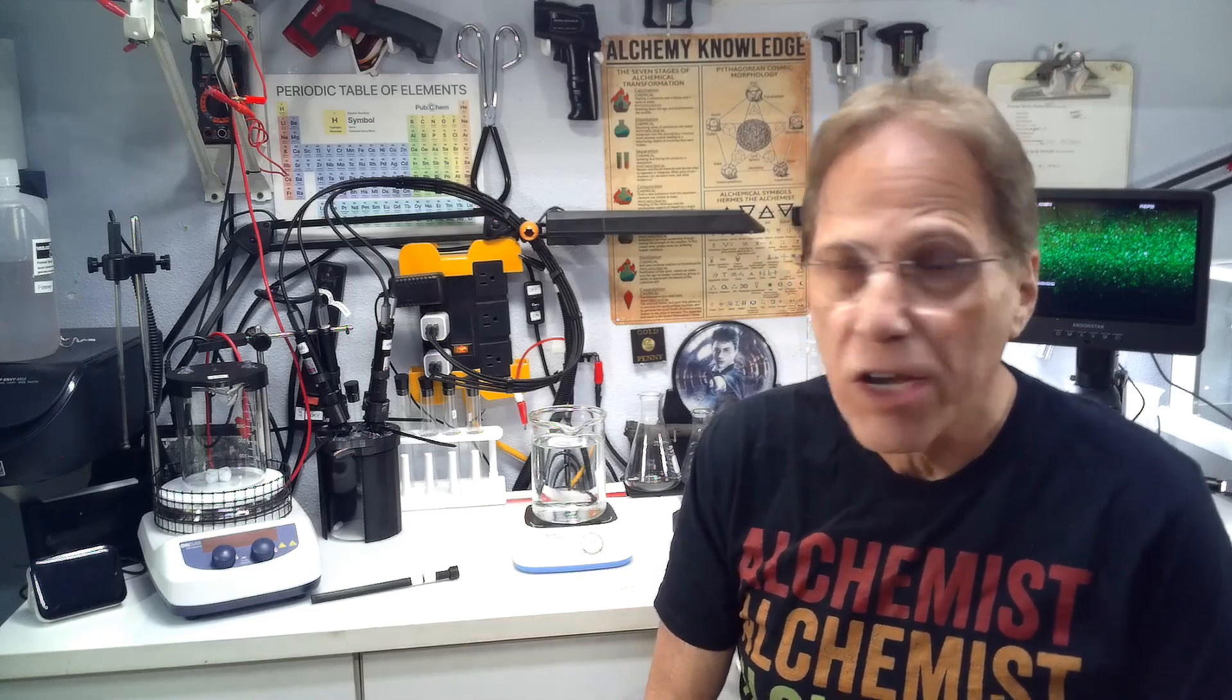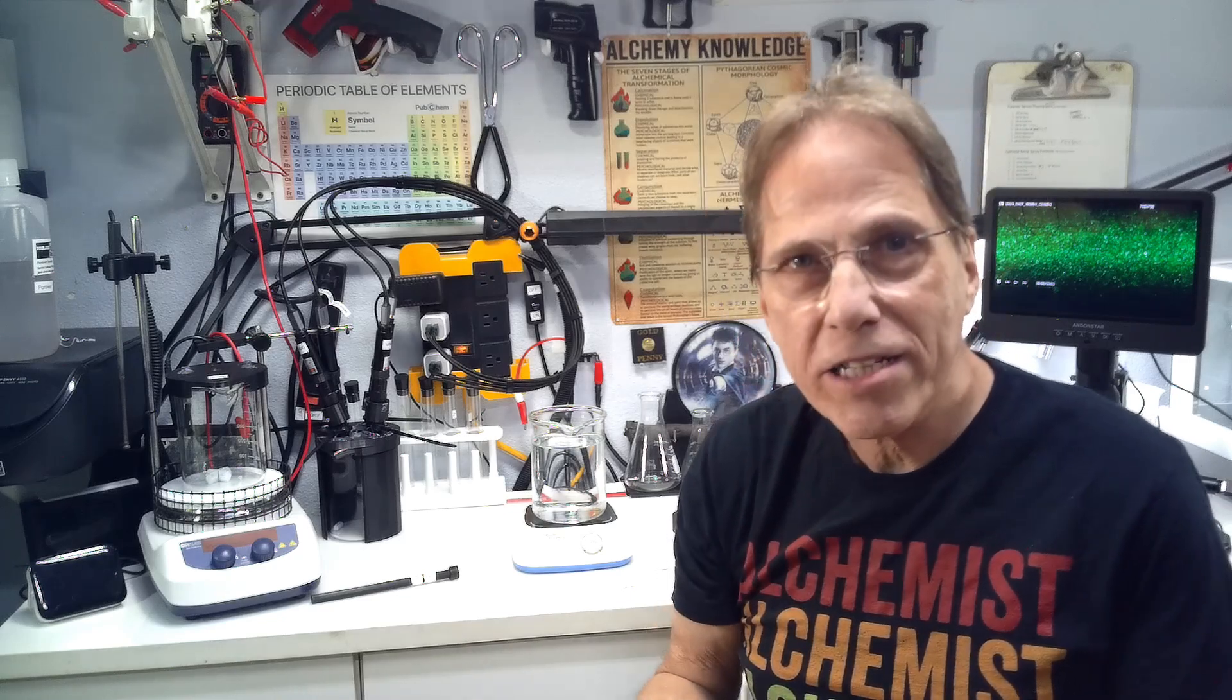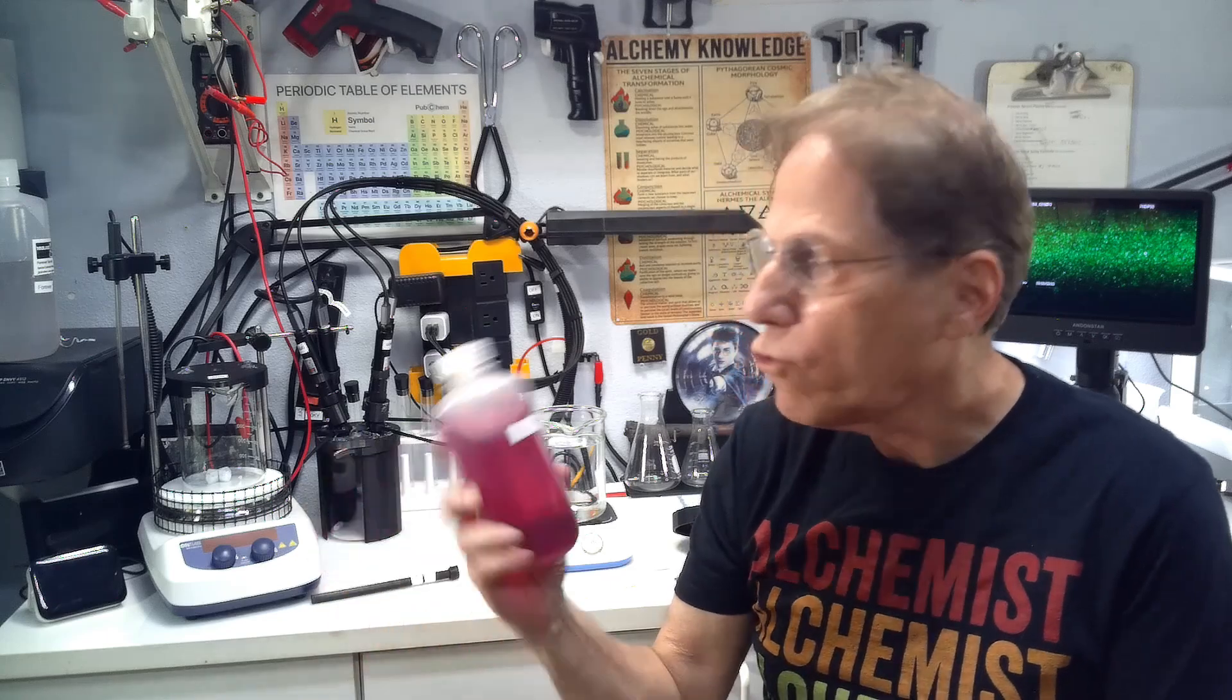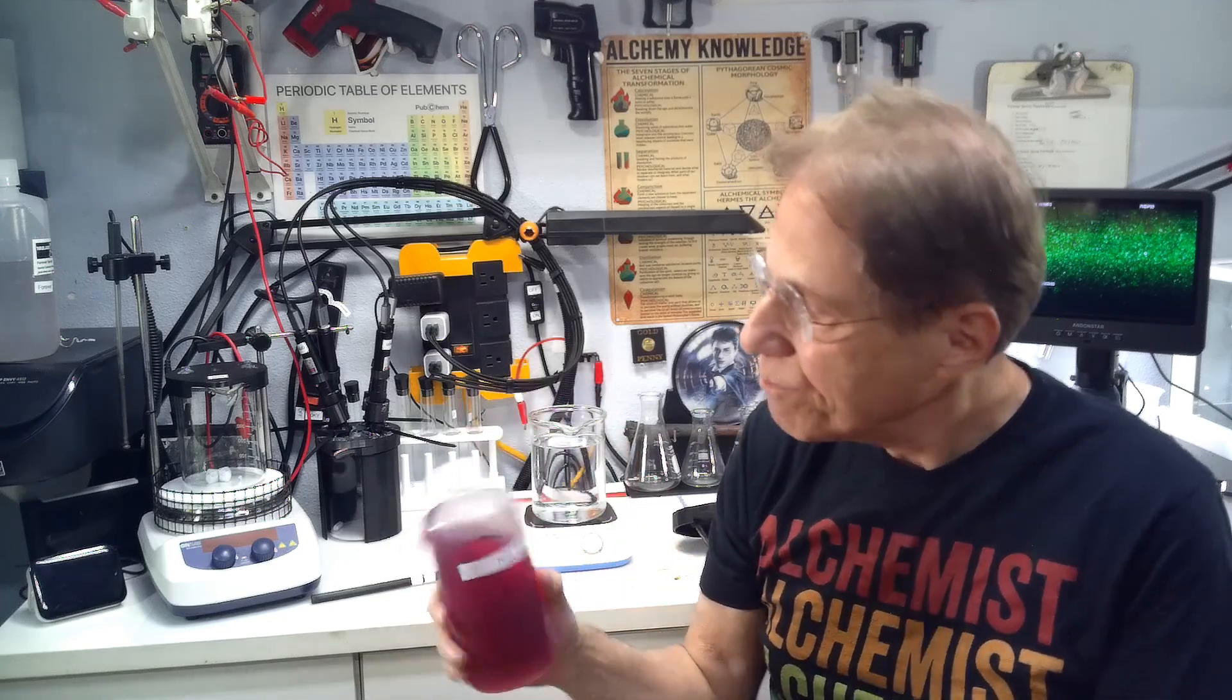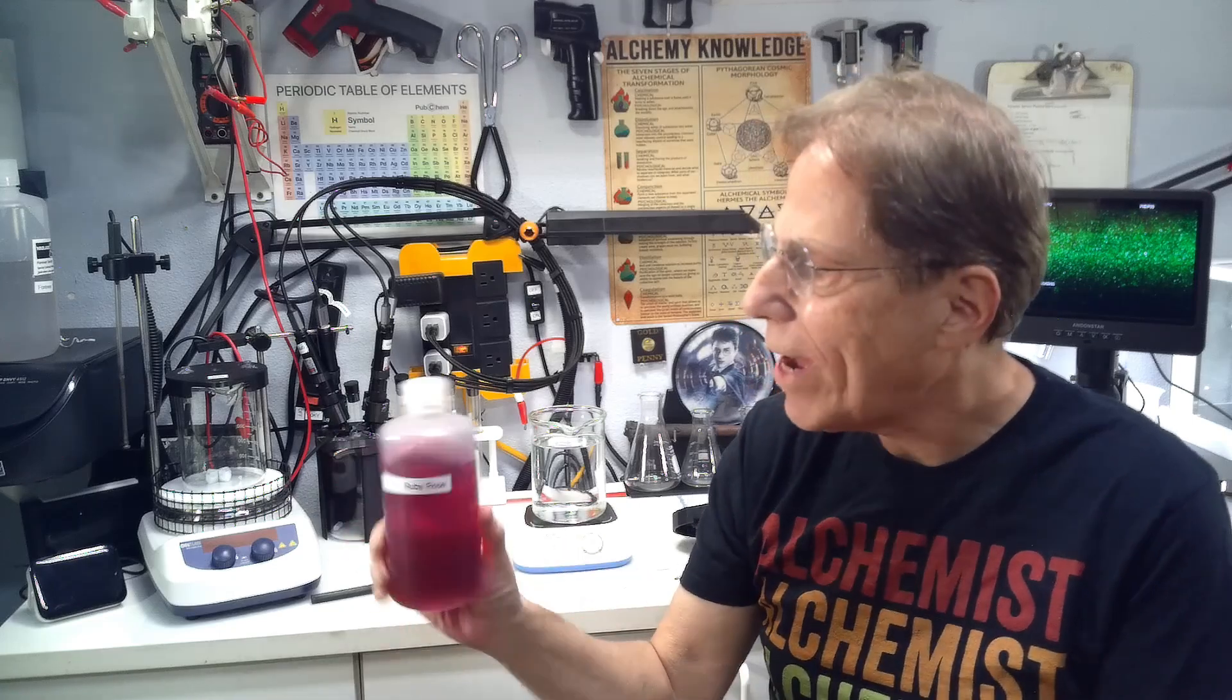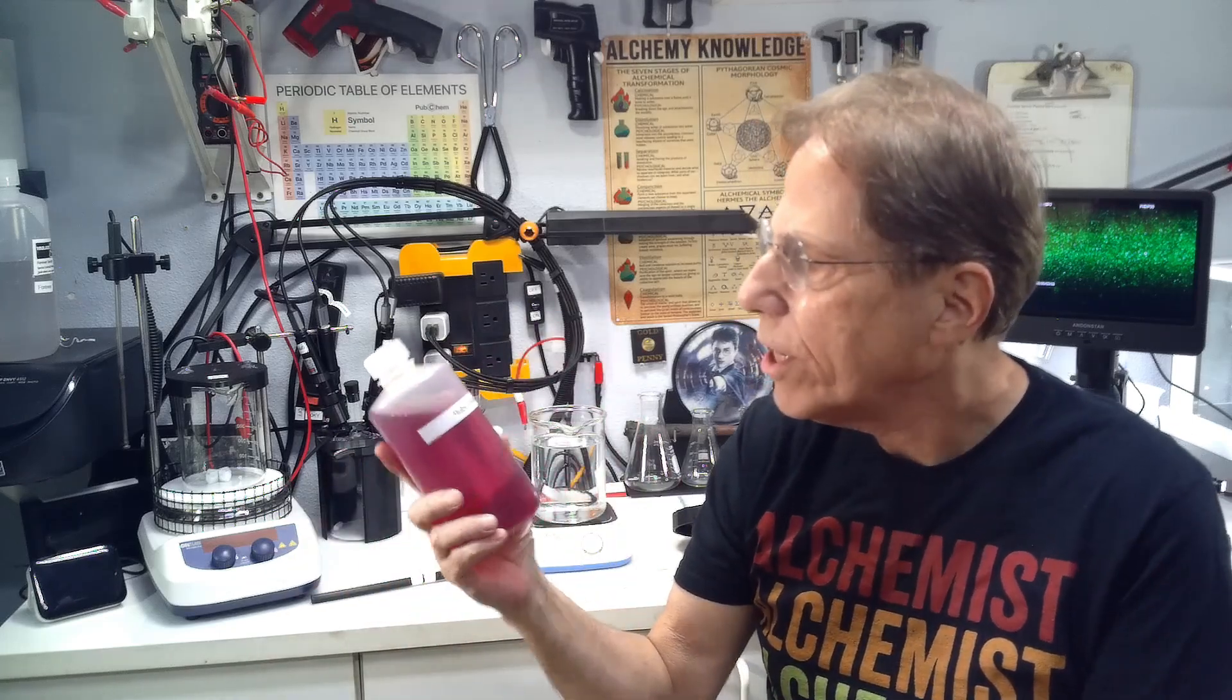I know many of you have ventured into creating colloidals with Plasma Arc. You've come to the same conclusion that I had when I started with low-voltage electrolysis—you'd like your colloidals as pure as possible. Unfortunately with low-voltage electrolysis, especially for gold when trying to create ruby red gold, you need to add quite a bit of chemicals. They're household chemicals, they're friendly, but you're still adding stuff to the mix. It's not a pure colloidal. In the case of ruby red gold, you have to create gold chloride in the process before you can get the colloidals created. Gold chloride in small amounts is fine in the body, but in larger amounts it's not. You can't say that solution is completely pure nanoparticles. The only way to get pure nanoparticles is with Plasma Arc.